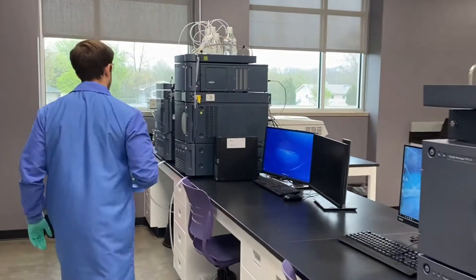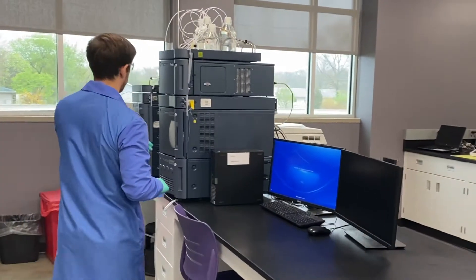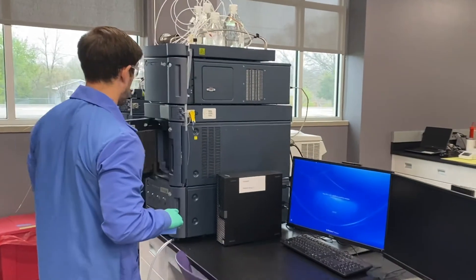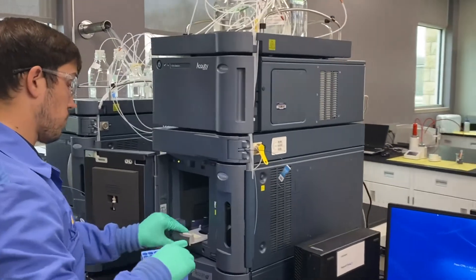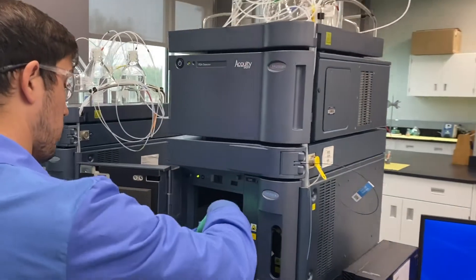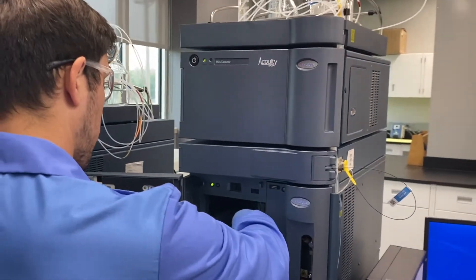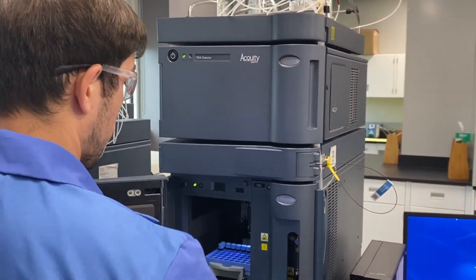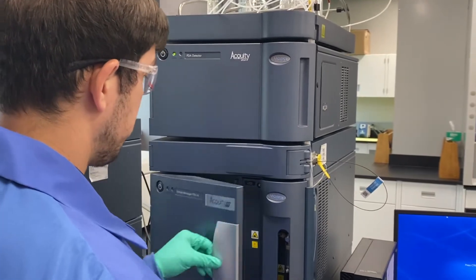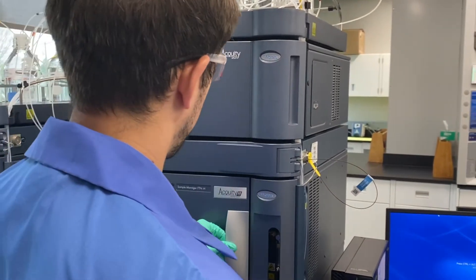The lab tests hemp samples to determine whether they contain less than or equal to 0.3% THC, using a method that measures both THC and its acid form.